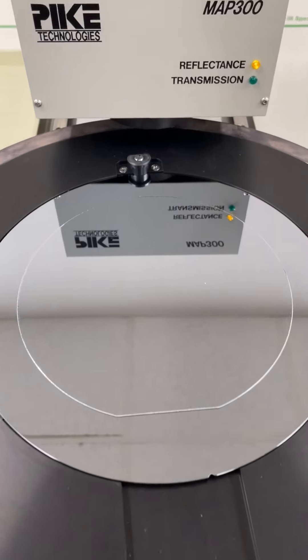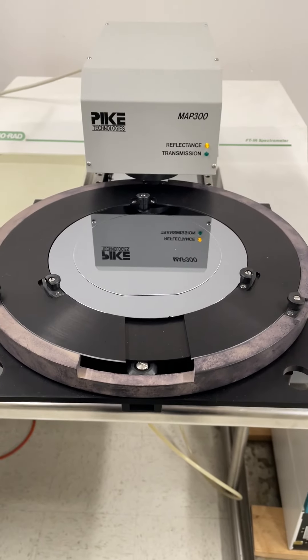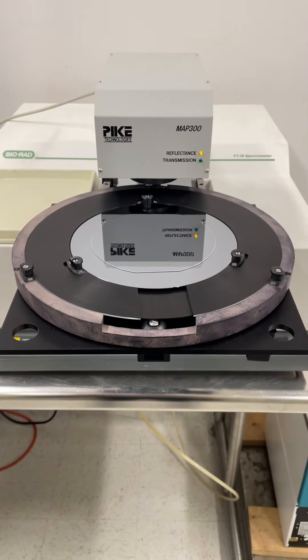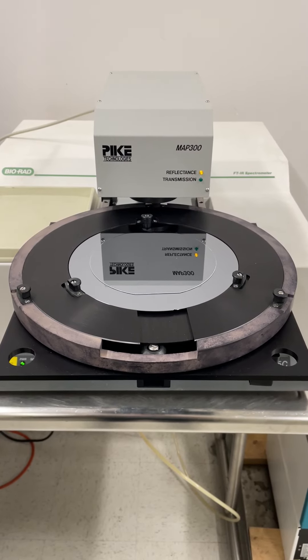This is a 6-inch, 100-micron epi wafer, and we're going to go ahead and run the 17-point test on it. I'll cut in and out so this clip doesn't get too long, but here we go.